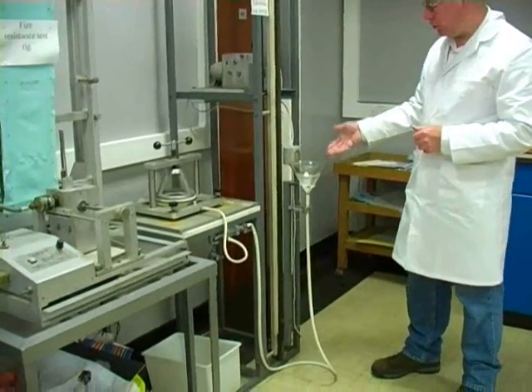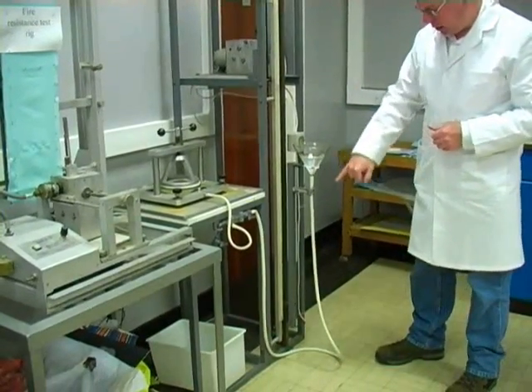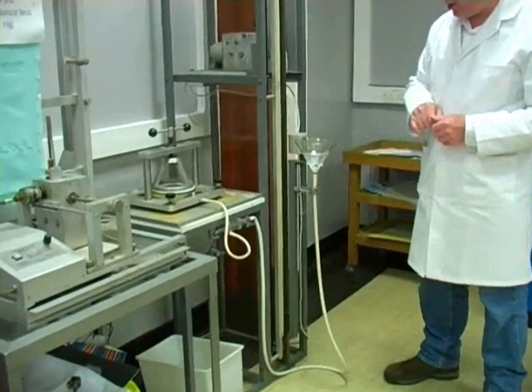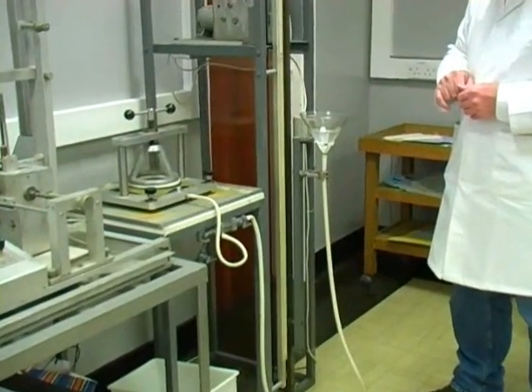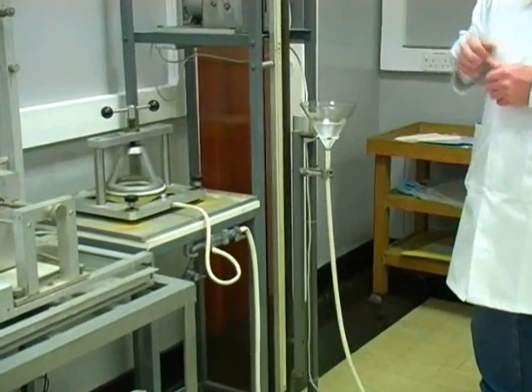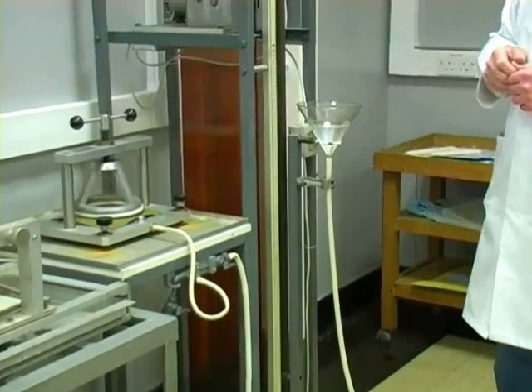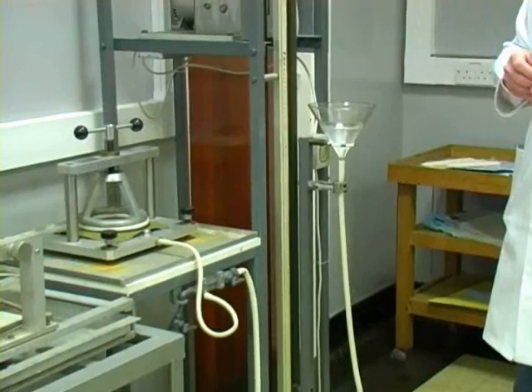And as you can see now, this funnel is raising up. That's causing increased pressure behind the sample, and eventually that water pressure will cause the sample to fail.